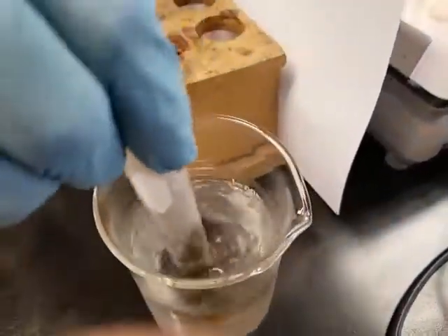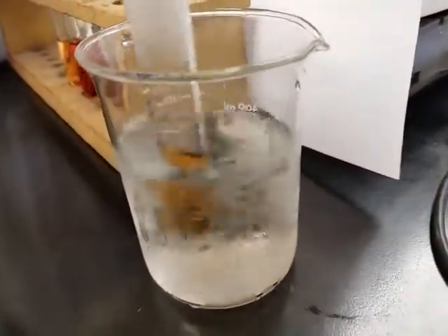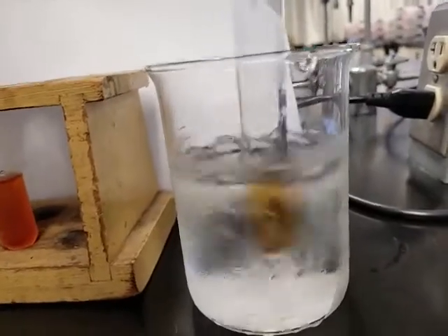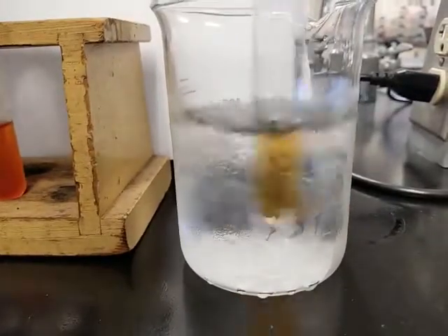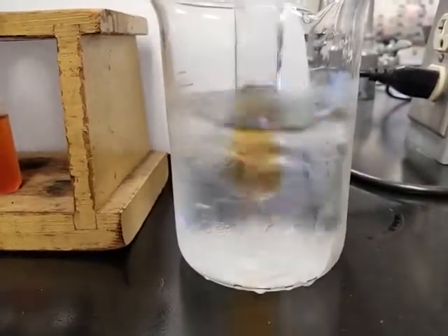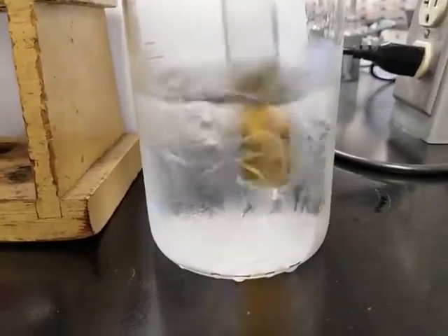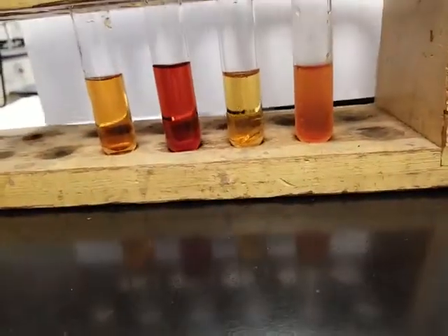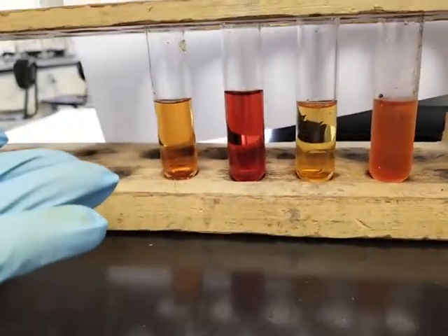Pull the test tube down. And see if Le Chatelier's principle actually is able to predict this outcome. It's not cold enough? Really weird. Oh well. My hope is that it turns darker to a noticeable extent, but it doesn't seem too much like that. Anyway, so this is the data that we have today. We're gonna have to stick with it.